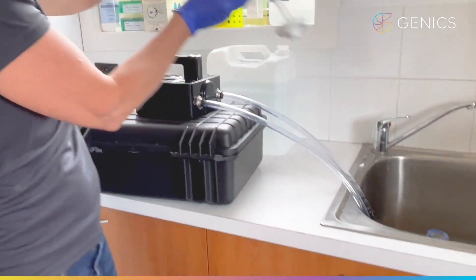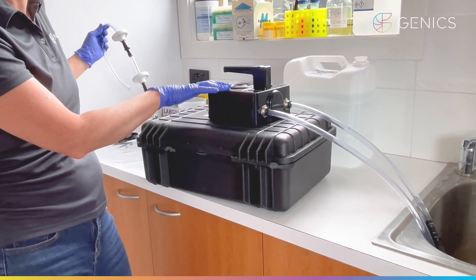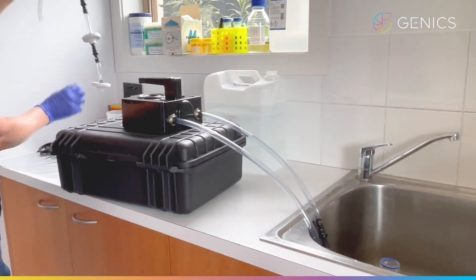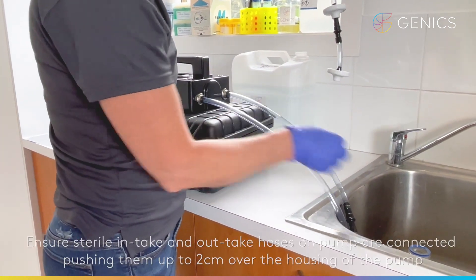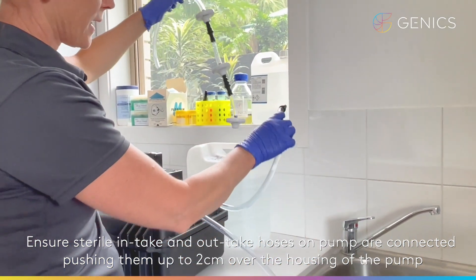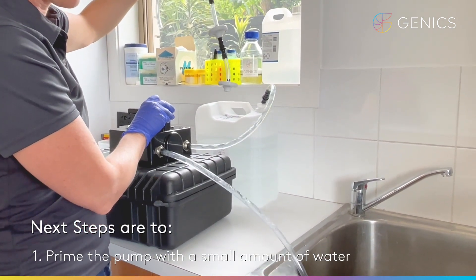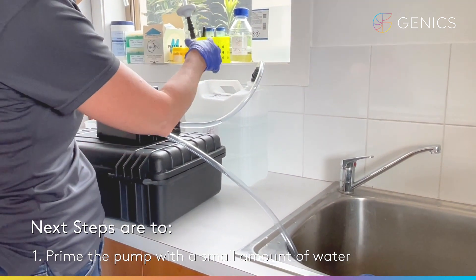So now we're going to connect this to our eDNA pump. Over here we have an eDNA pump — this is a specialised pump designed to pump the water at the right flow rate across these filter cartridges for eDNA sampling. This is already sterilised and pre-connected to the pump. The first thing you'll probably need to do in some cases is to prime the pump — you can prime your pump without the filters connected, just get some water to go through the hoses, which will help it to pump the water through the filter housings.